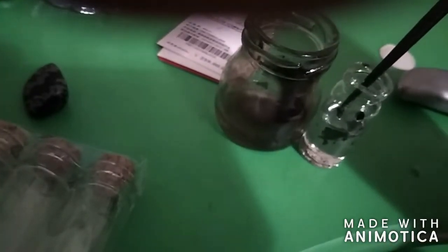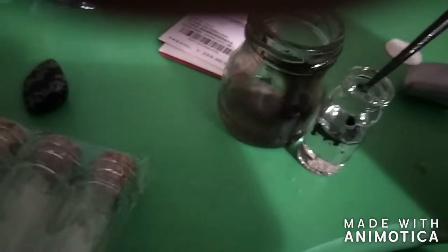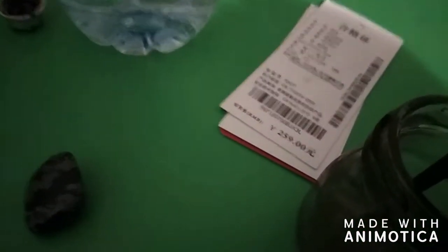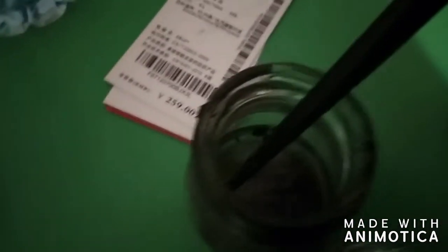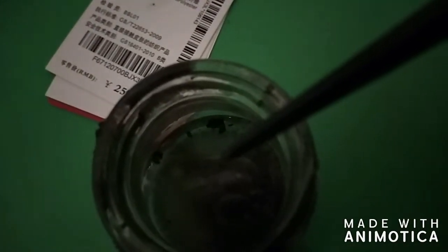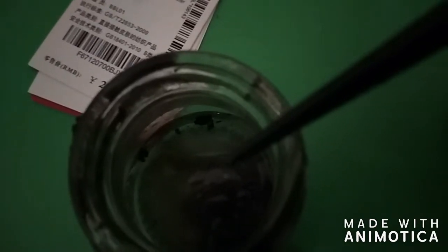But that really didn't work, so I just scraped it off with my craft knife and put it in some mineral oil. Just for you guys who don't believe me, I'm going to put it in water and it should start fizzing. As you can see, it's fizzing very vigorously, showing that it is a very reactive metal.